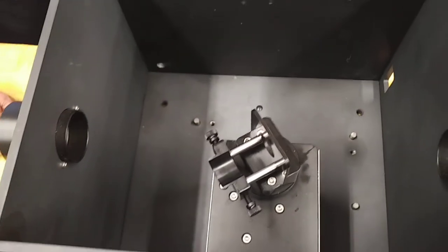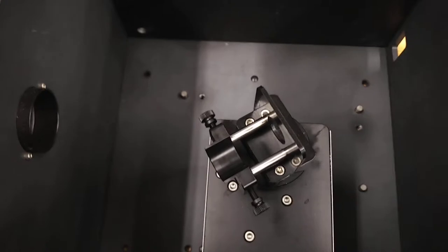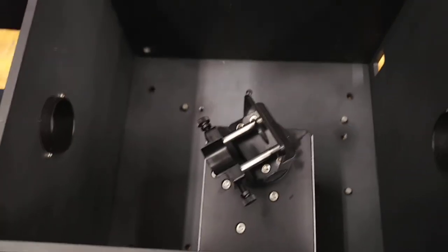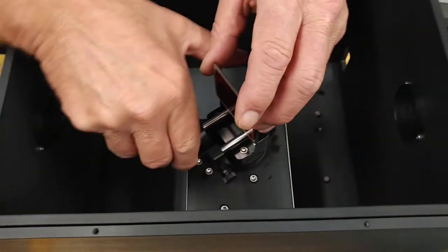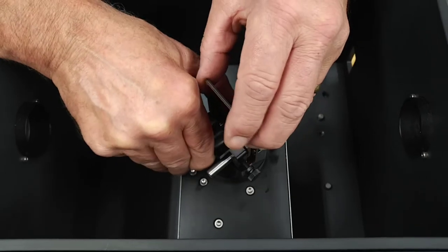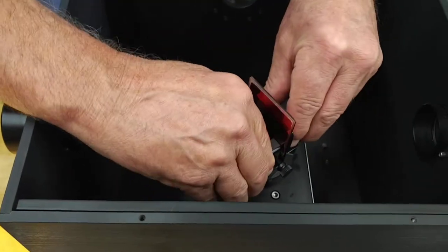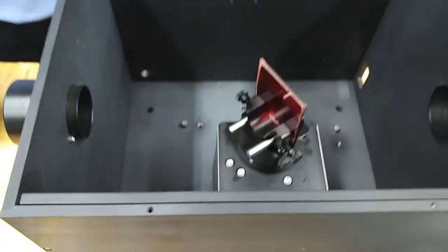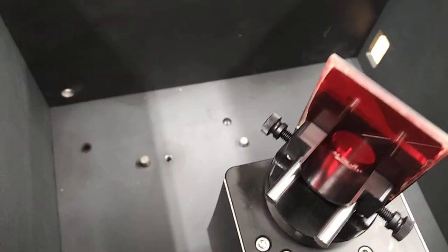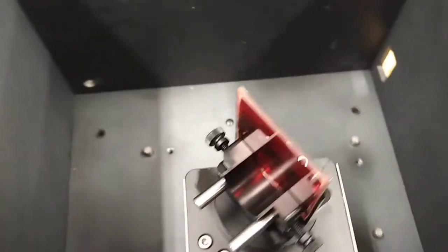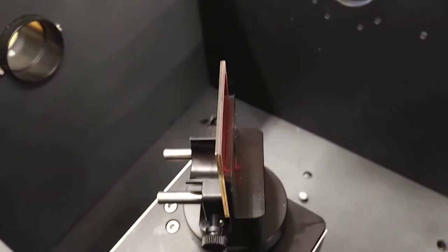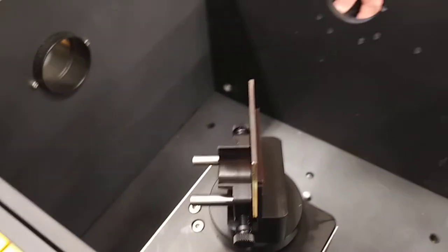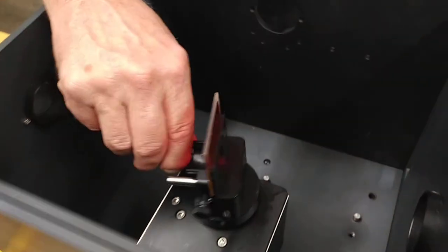So Rich is going to start with a sample that you might be likely to use, a nice square relatively thin colored piece. He's now installed this into the instrument, and ordinarily this would be under computer control and you'd be able to adjust the angle.